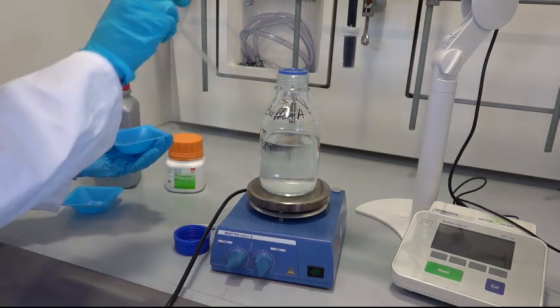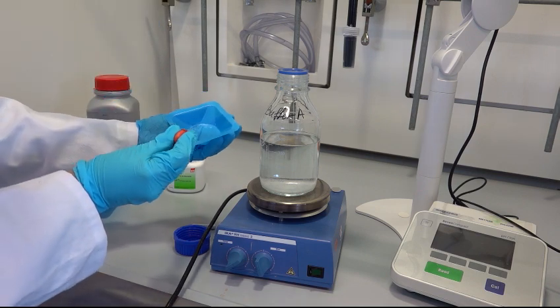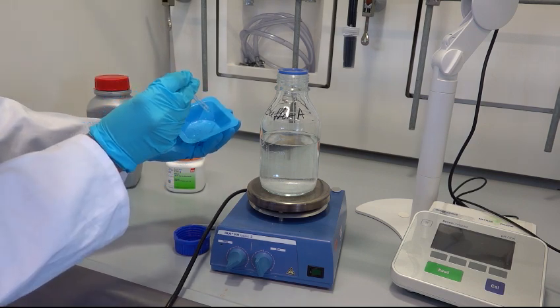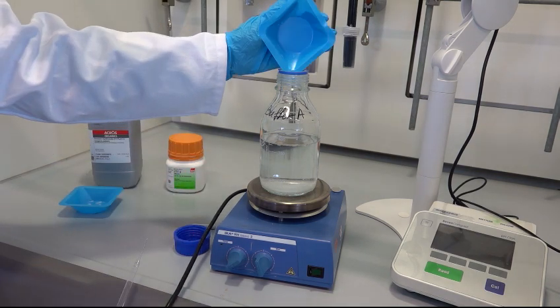While the reactants are added, to avoid some losses, use a pipette to get some of the buffer and wash the walls of the vessel, and then put it back.